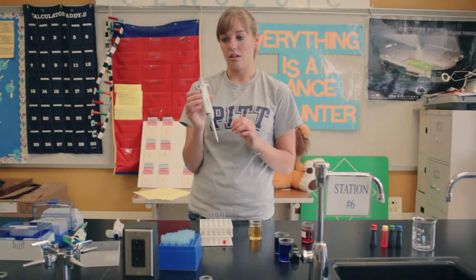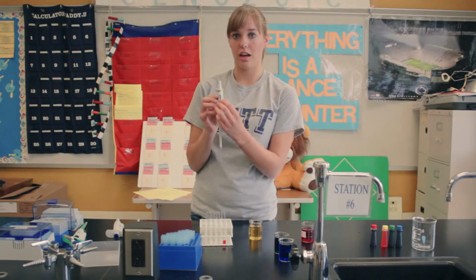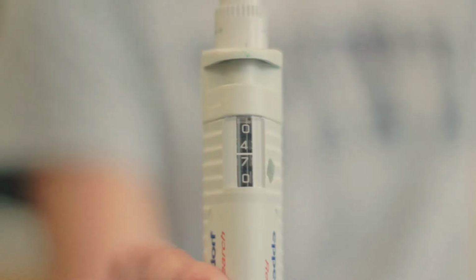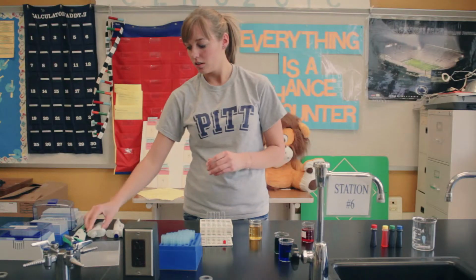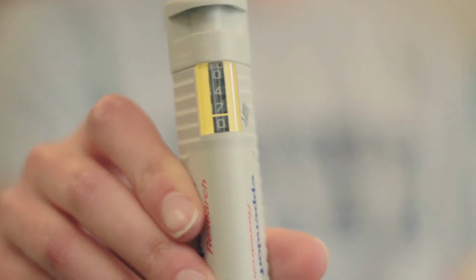Each micropipette in the Eppendorf is numbered differently, and depending on where the line is, that's how much you have. This one's 4.7, this one's 470, and this one's 47.